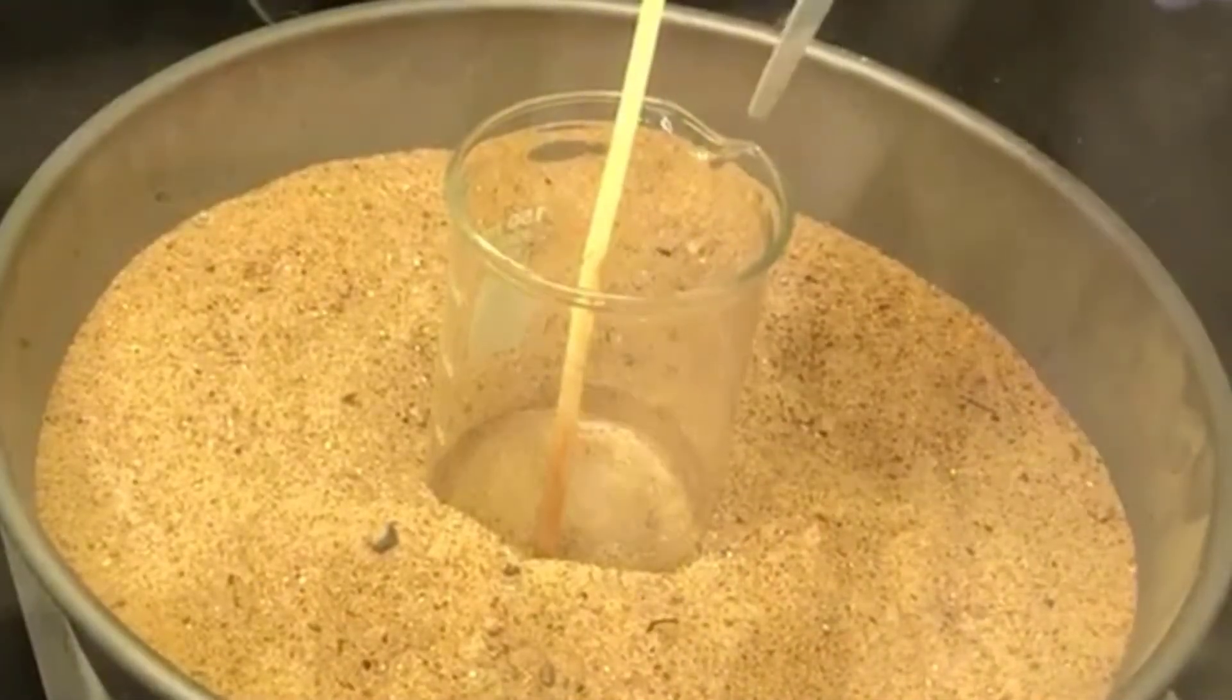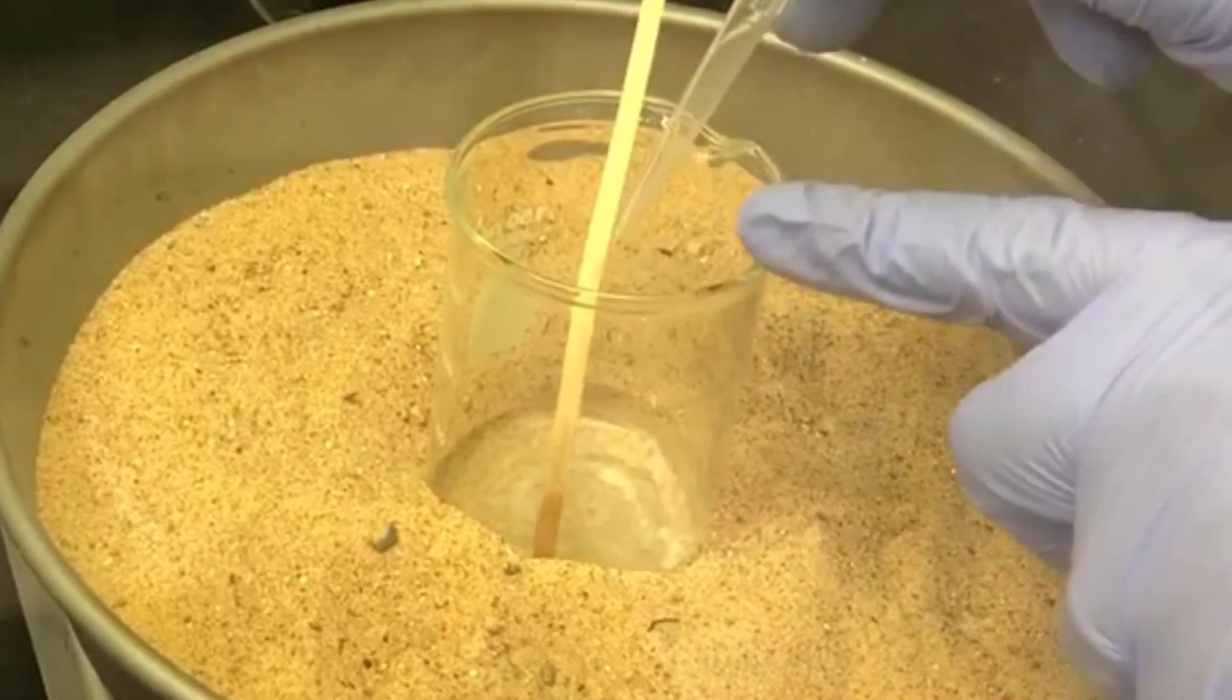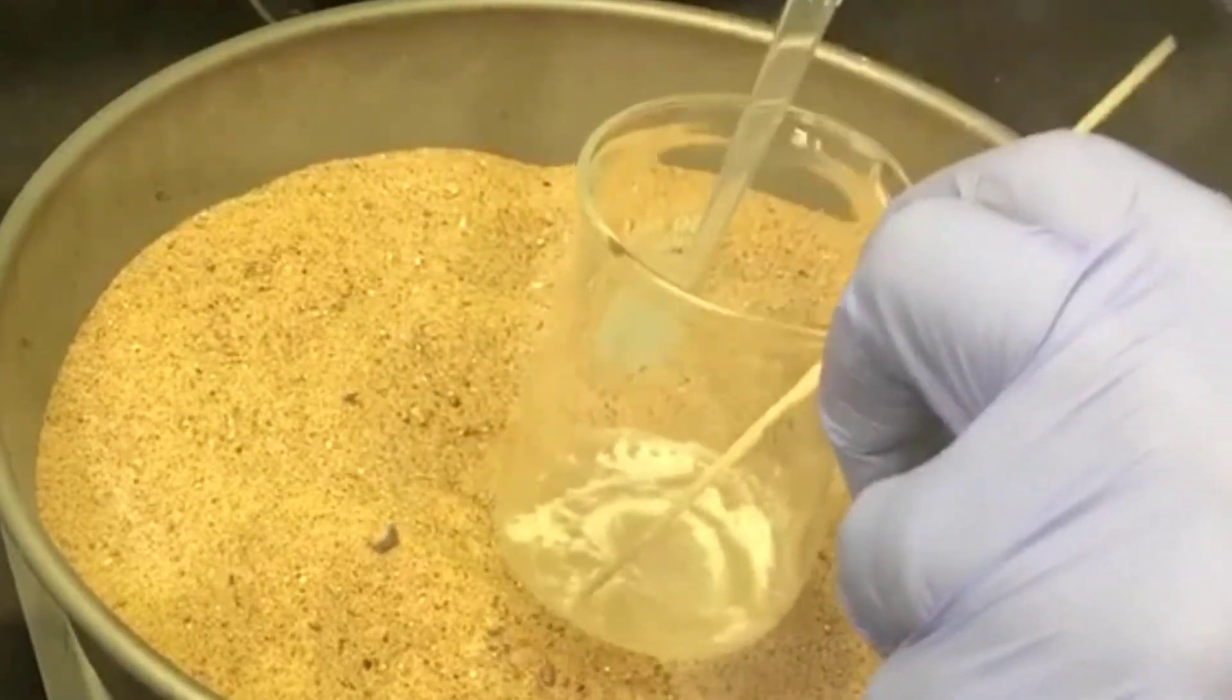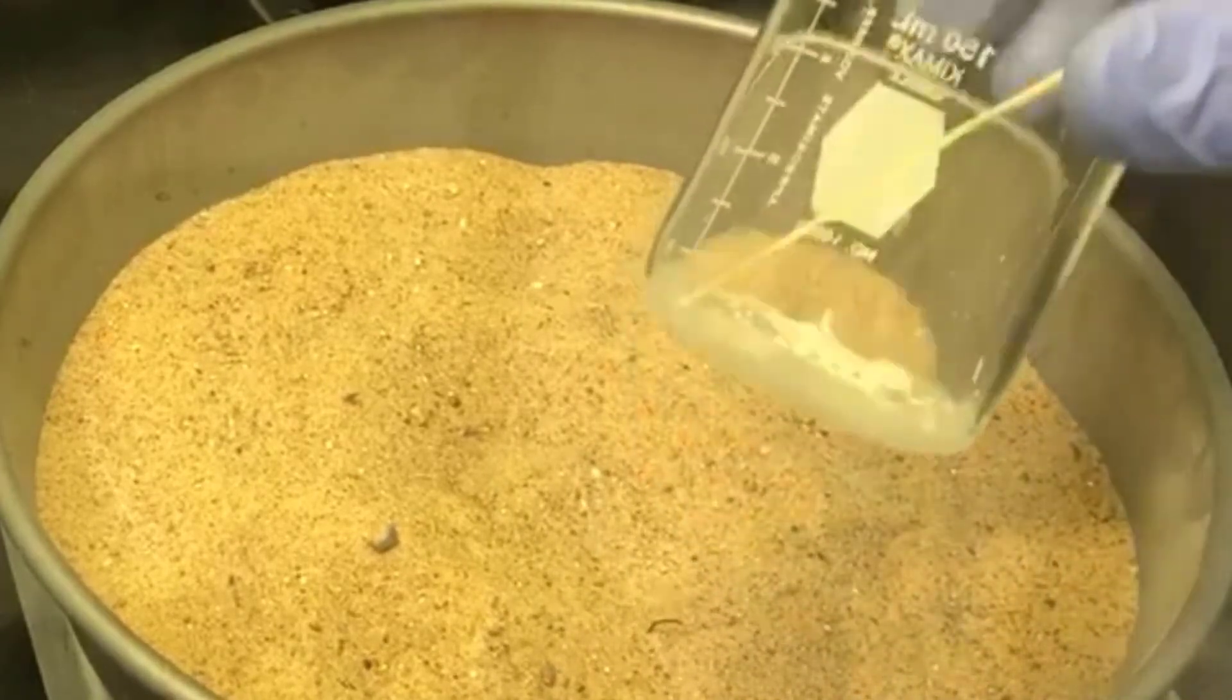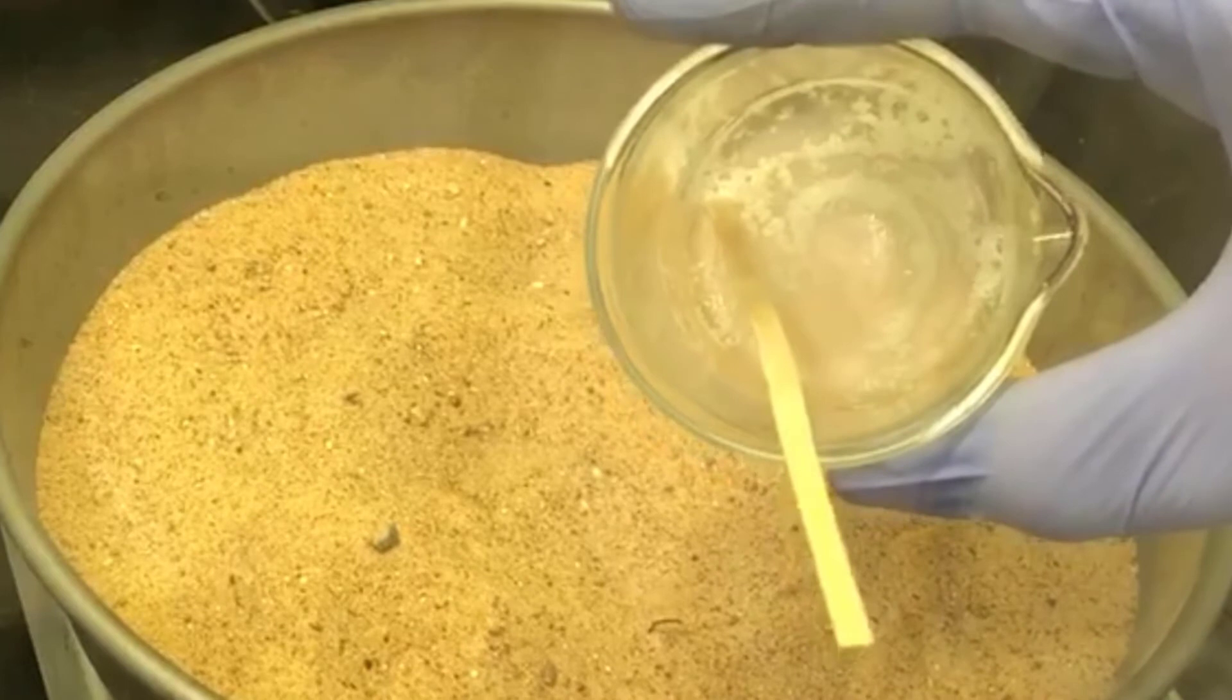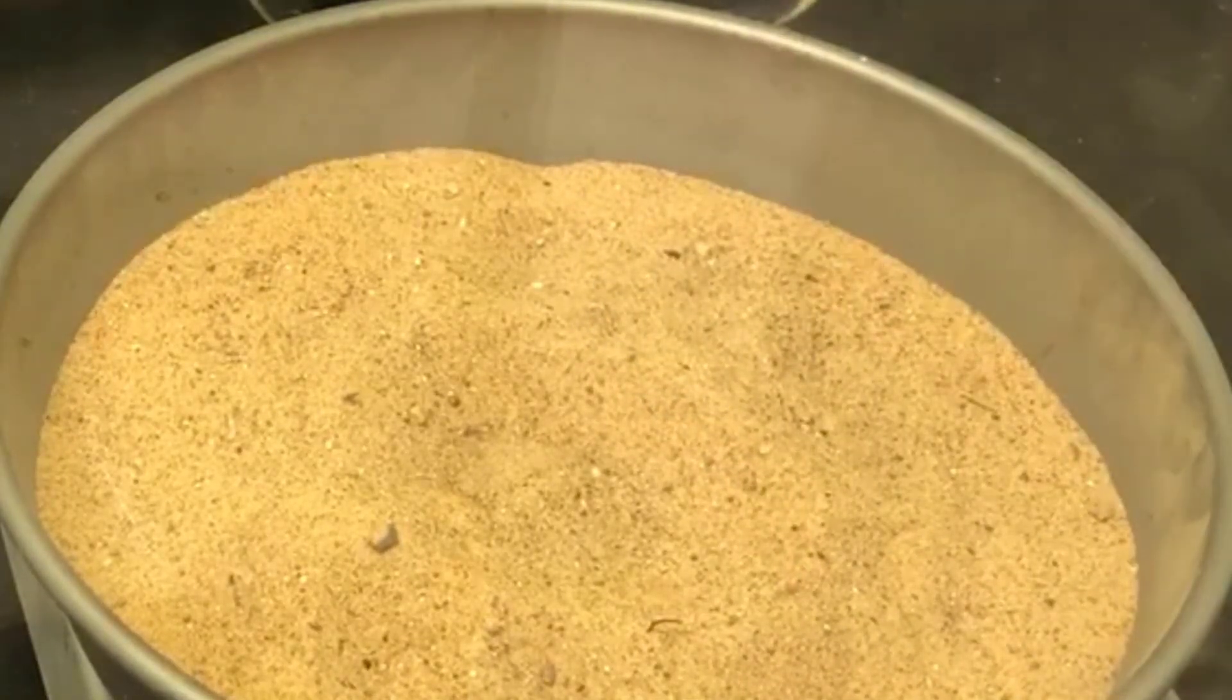Now I'm at the end of the evaporation process, and you can see the last bits of ethyl acetate evaporating and leaving behind a white residue of caffeine. It's important at this point not to overheat the solid. Take it out of the sand bath as soon as the solvent disappears. The boiling point of ethyl acetate is 77 degrees C, and as long as there's ethyl acetate present, it'll always be at 77. But as soon as the last bit of ethyl acetate disappears, the temperature goes up really fast. To avoid charring the product, take it off as soon as the ethyl acetate evaporates.